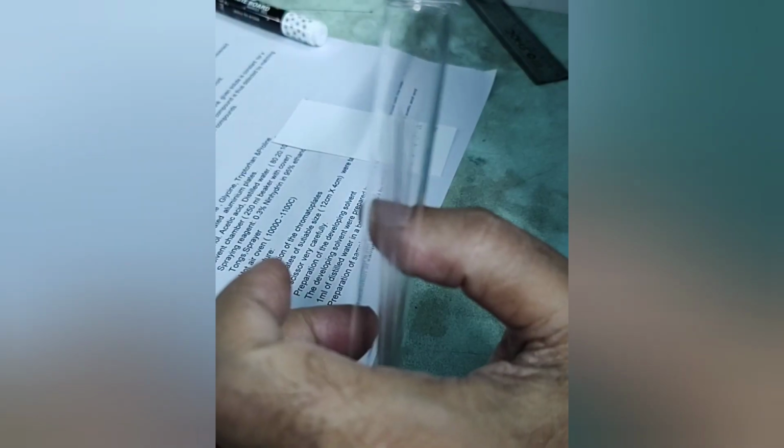After that, as you can see, the TLC plate, which is pre-coated with silica gel, is taken and the baseline is drawn 1 cm from the bottom. Now here the positions where the amino acids will be put are being marked. Name them with the initials of the amino acid so that it becomes easier for us to understand after the experiment which amino acid was put.